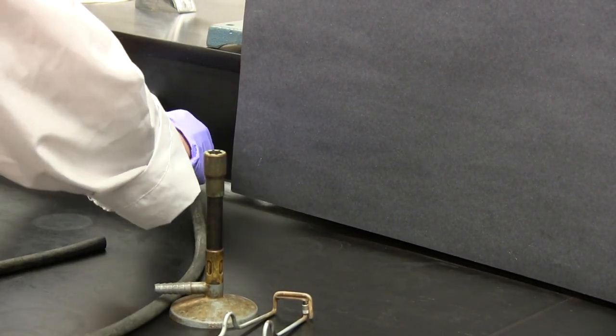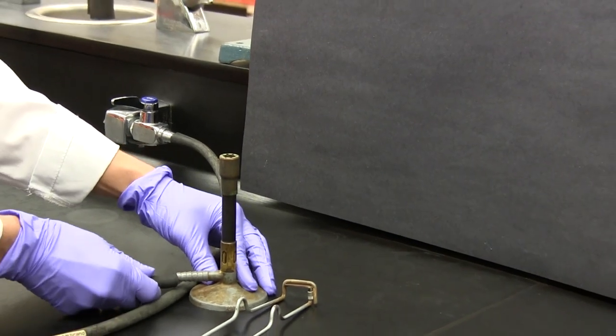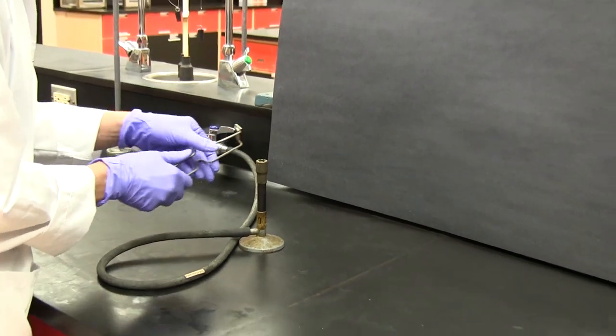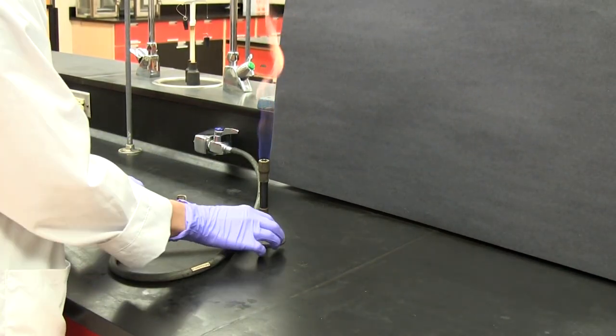So with the air vent closed, the tubing is connected, the tap fully turned on, and the gas ignited with a spark.